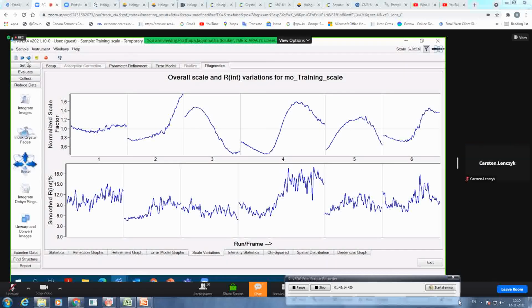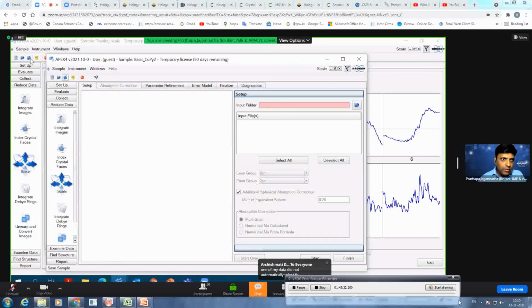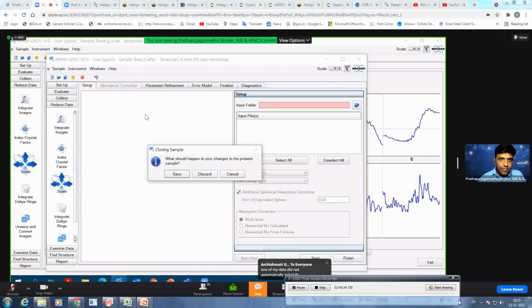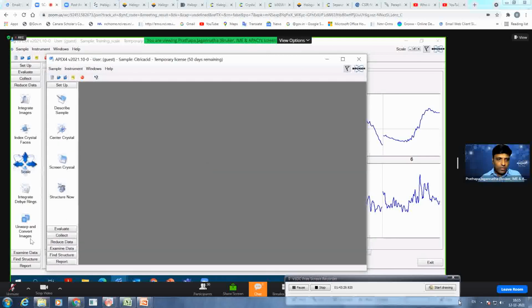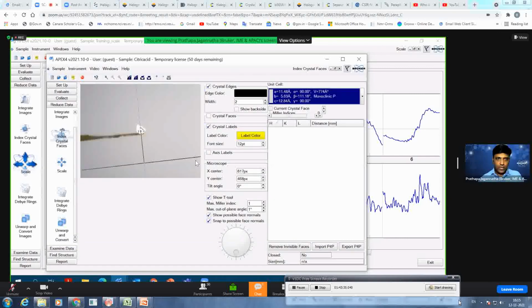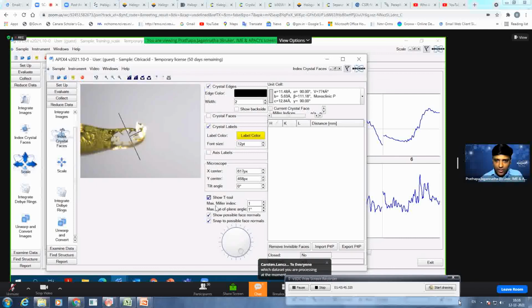Let's see. This is a citric acid. No, I think I changed that. Okay. Reduce data, index crystal faces. Yeah, here we have got some. So just for arbitrary, look at a custom crystal. It's very small, so I just make it. Okay, let's quickly do it.